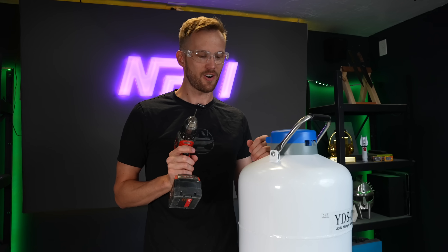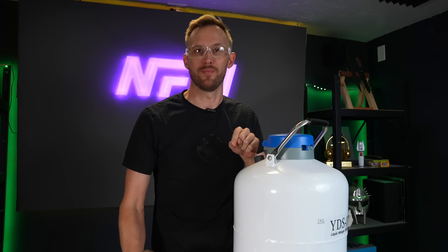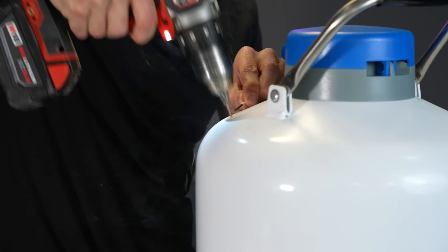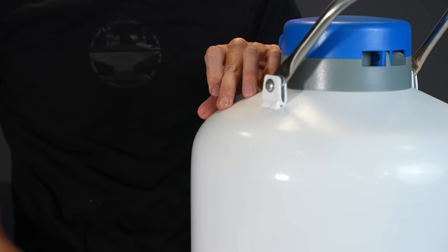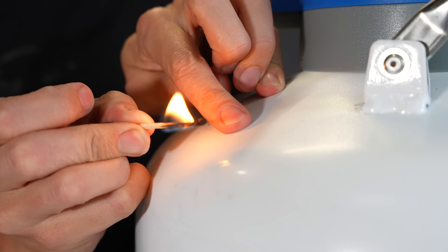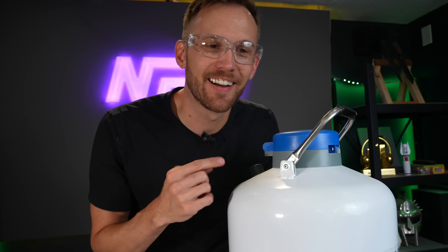To start, I'm going to try and drill a hole into the side of this container. I believe it has a vacuum in it — just give it a little divot. And look at that — it's a vacuum! I didn't see smoke but I heard a hissing noise, and when I put my finger over it, it sucked right down to it. We've got a small hole and it's still sucking air in. You can kind of hear it going.